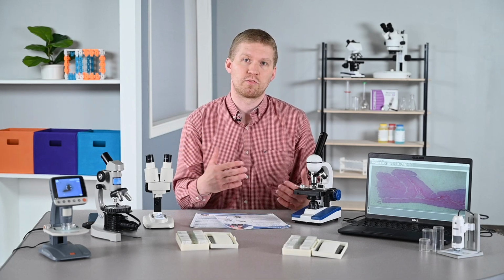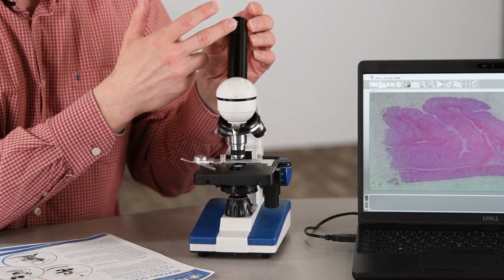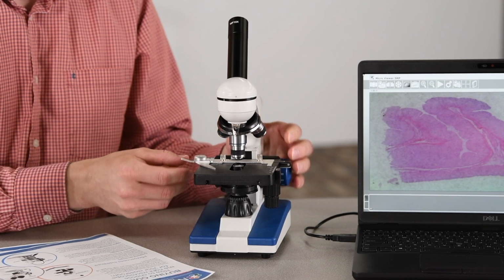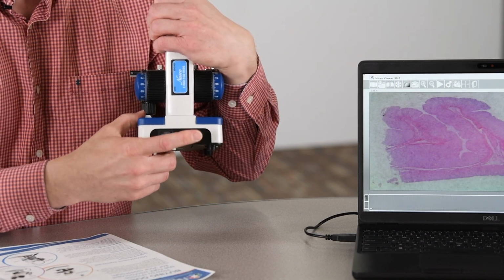And once you become familiar with these features, a lot of them can be visually seen on a microscope. So for example, without even looking at the specs sheet at this microscope, I see that it has that 10x magnification on the eyepiece. It has your 3 different objective lenses that are nicely labeled. You have mechanical stage, coarse and fine focus, and you can also tell that it's corded based on the back here.